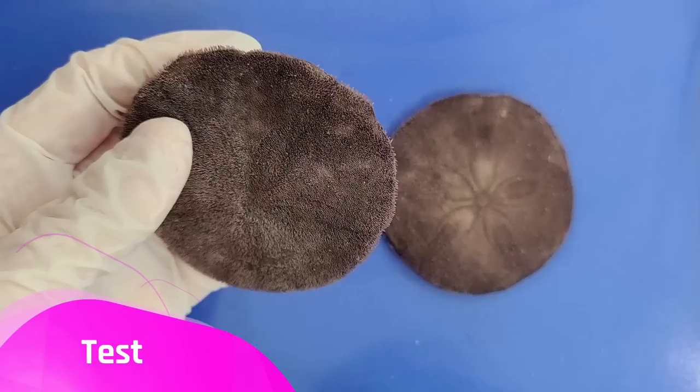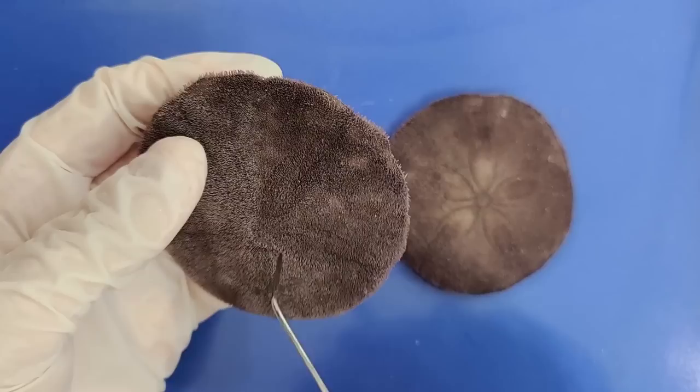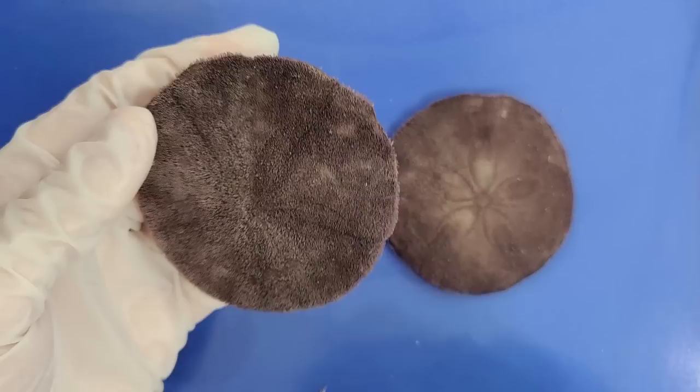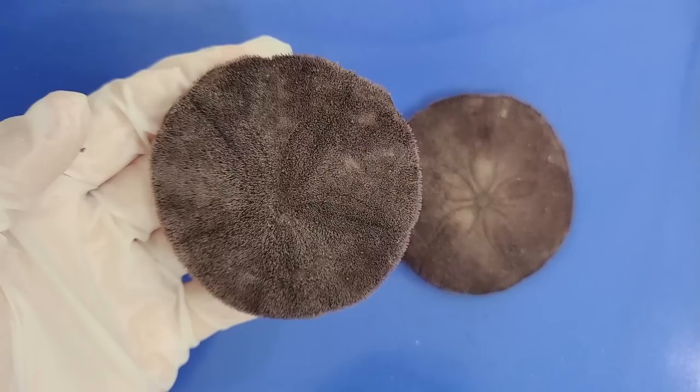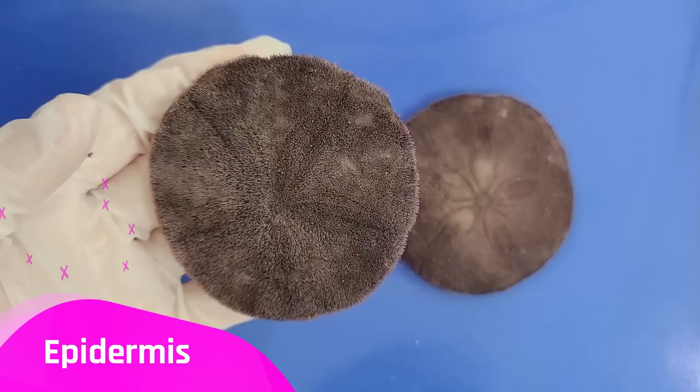This hard covering is the skeleton of the sand dollar, and it's called the test. This is the part that gets bleached white and washes up on beaches when the sand dollar dies. The test is hollow, and most of the animal's soft parts are inside it. It's not hollow around the edges, but in the center where the organs are, it's hollow. The test is actually an internal skeleton, not external, because it is surrounded by a very thin epidermis.